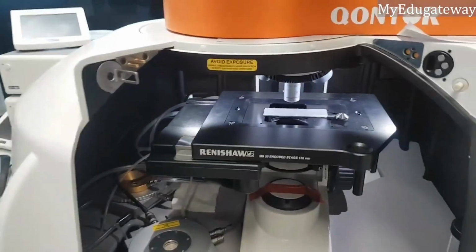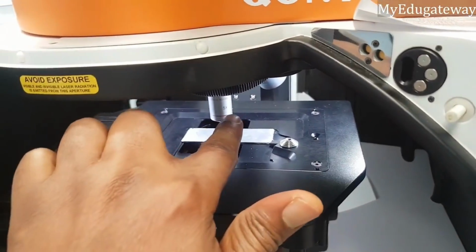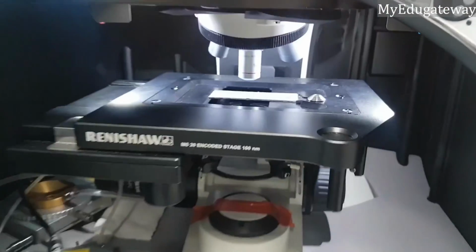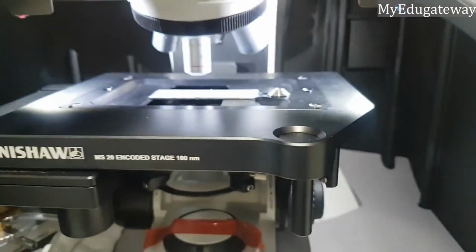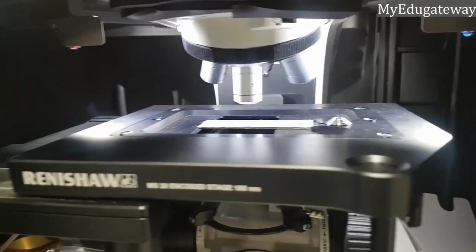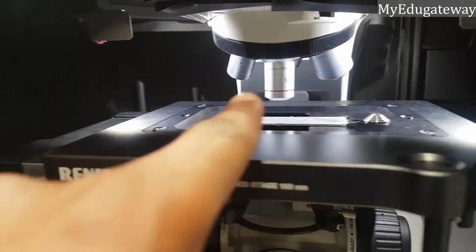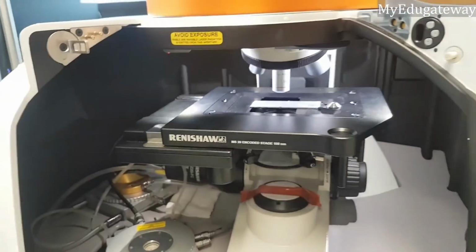Okay, so basically I'm using, it is written on it, you can see. So there are different ones there. You have the 20, that one is 50. So you have 50, this is times 5, there's times 20, and so on. So this is times 5. So I'm using times 5.